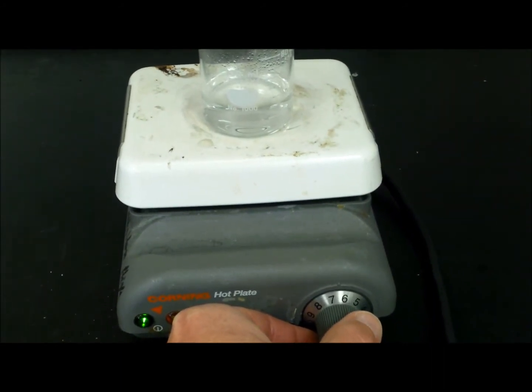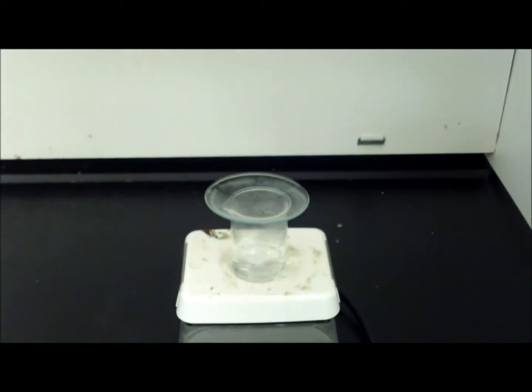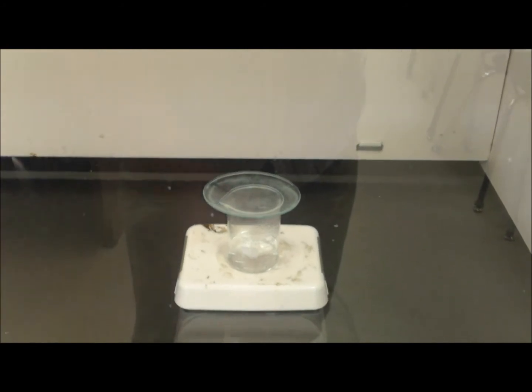Put it at about a six or a seven setting. And then I'm just going to go ahead and close the fume hood and turn on the blower.